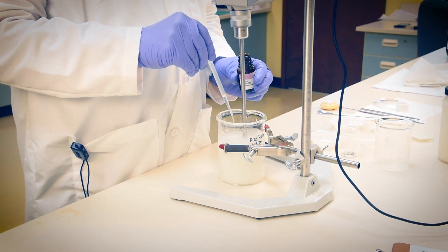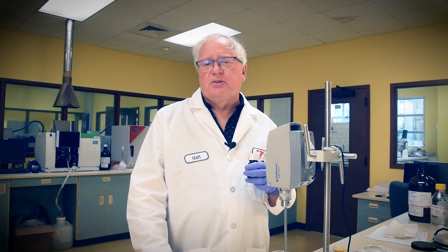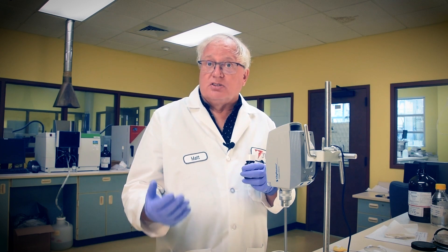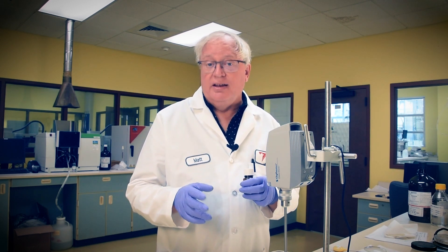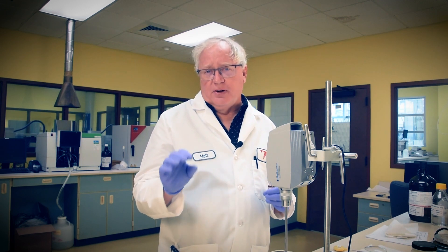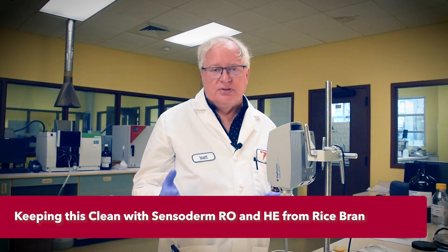The batch is now cooled to around 45 degrees Celsius, so let's add the remaining elements of our rice factor lotion — the preservative and the fragrance we selected. At this penultimate stage, you may wish to add any specialty ingredients selected for your application or to meet your label claims. Our pH is in the right zone for most, right around 6.0. These may be in the form of extracts, composites, or any functional materials you've investigated and sourced. There are many to choose from, and our system should support most. But remember, clean beauty means making a fine and functional product by using less. Don't get carried away and add a bunch of additives just to make for a busier label.